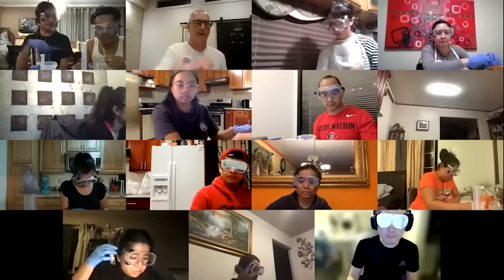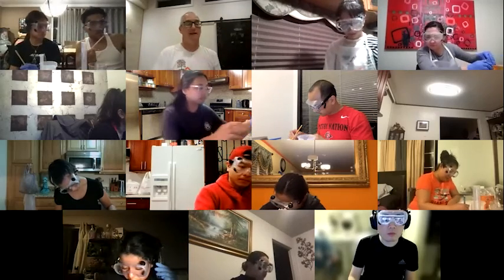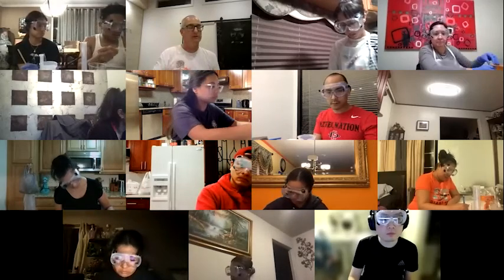So once you got it burning, there you go. Quick, quick, quick. What happened? Oh, that's CO2, right? That won't do a damn thing. Basically, you're testing for oxygen, and the answer is, is there oxygen? No, there's not. So put the towel back over it to shake it up a little. Now put the burning splint in, and it should go out.